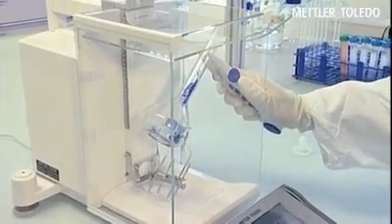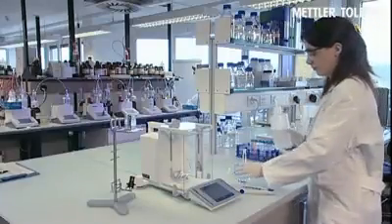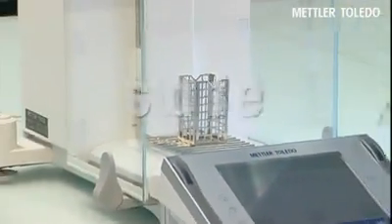Using ErgoClips leads to fewer working steps, reducing the weighing time by 2 to 3 times. ErgoClips, the perfect choice for simple, safe, and fast weighing.